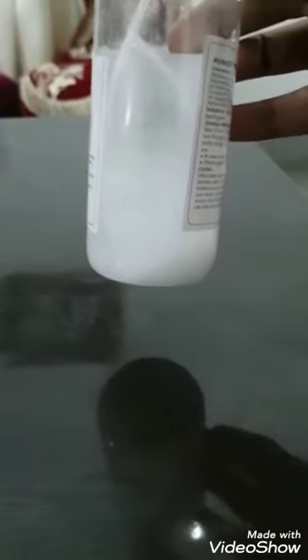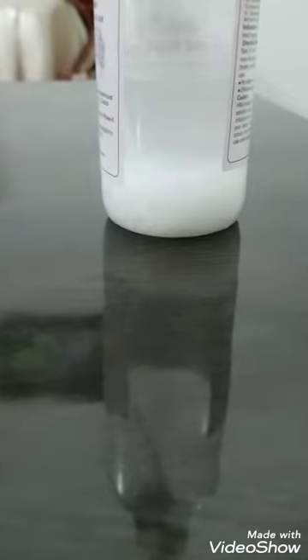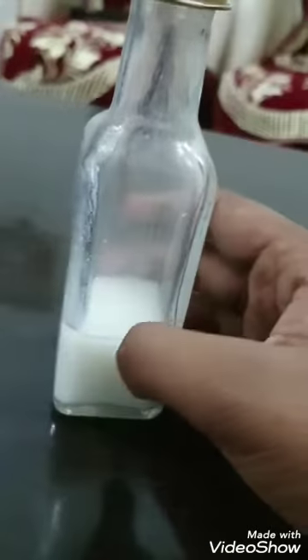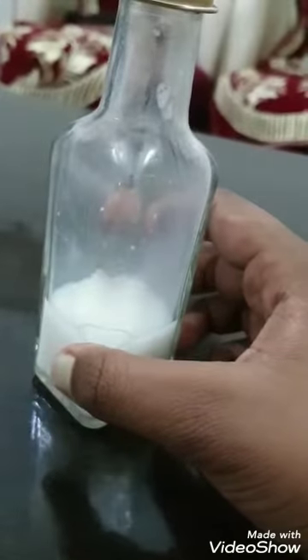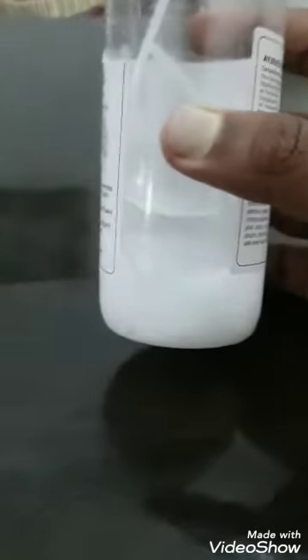If I shake this a little bit, it all merges up, and then with sedimentation it slowly moves to the bottom. I actually like the way it looks this way, so I didn't go with the separation method. I just did this to show you all how it's going to look when you separate it.